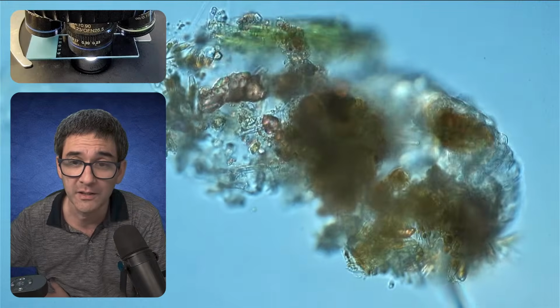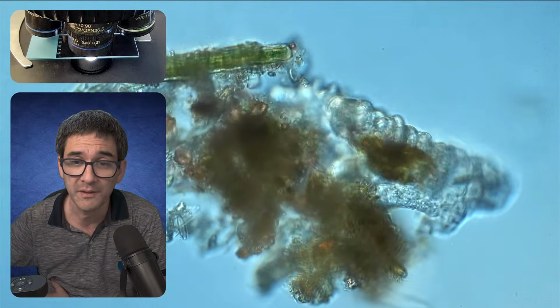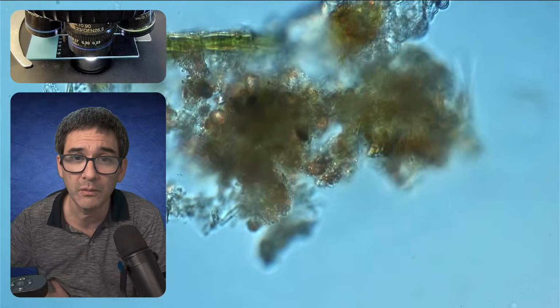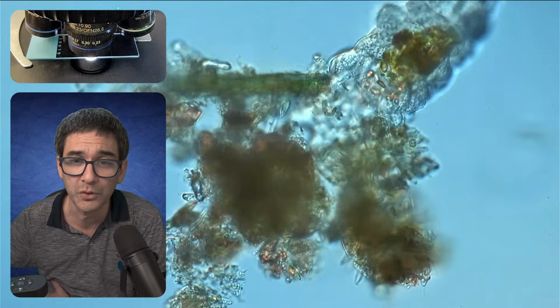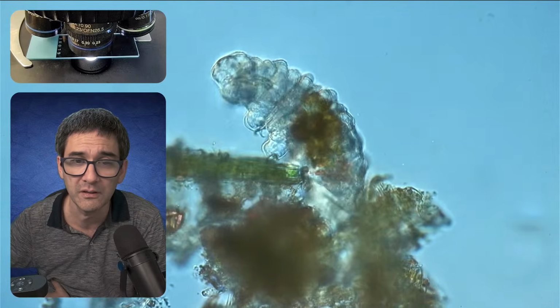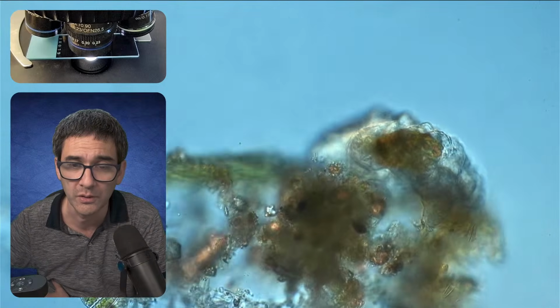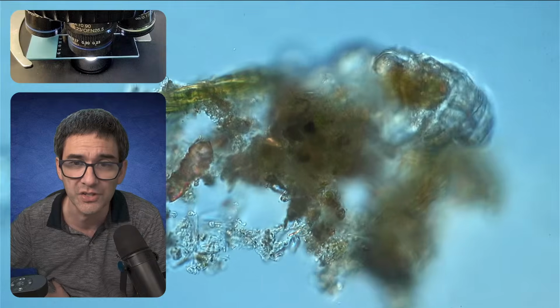At that time, this was easy because the cell wall was so visible. But then later, Theodor Schwann, another scientist, said all animals are made of cells. But now, where can you see the cells over here? A tardigrade water bear is made of approximately 1,000 cells. But honestly, I cannot see them because those animals do not have a cell wall, right? So we do not really see where one cell stops and the other cell starts.